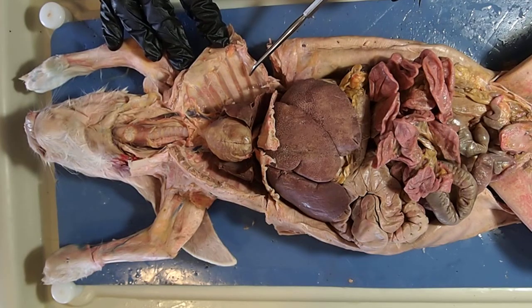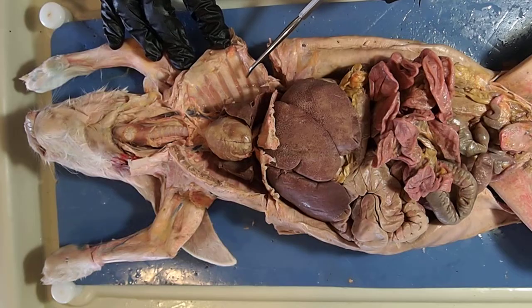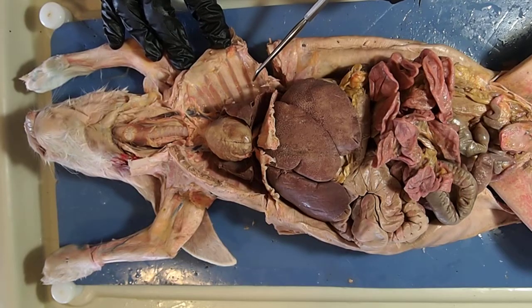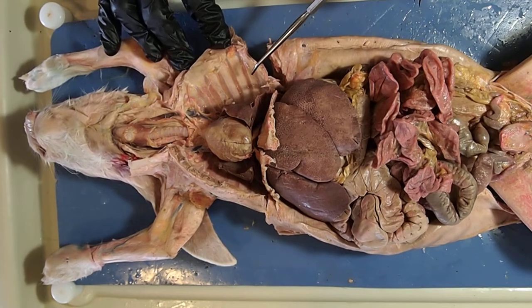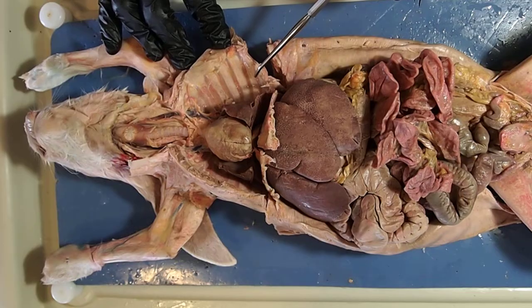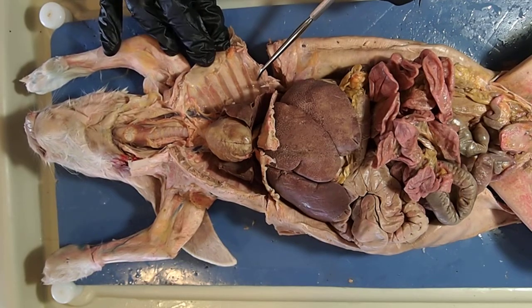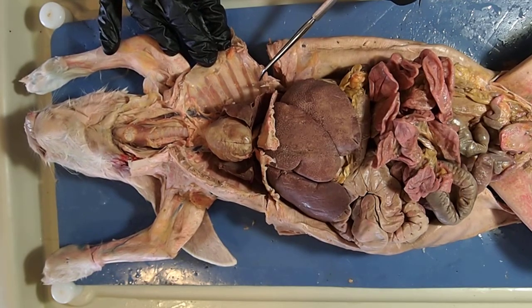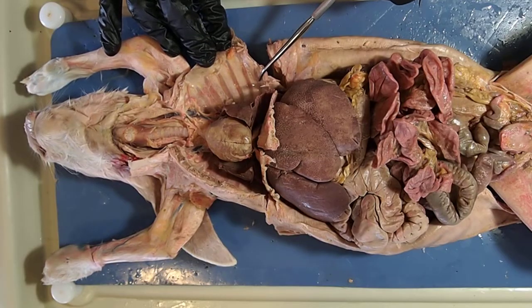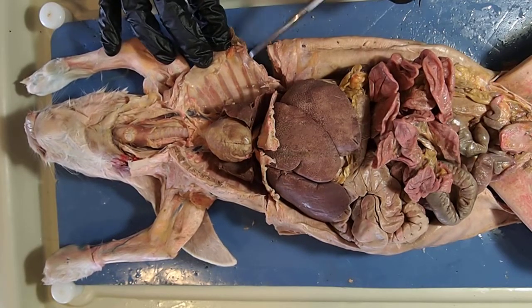You have the lab document with still photographs of all of these images and parts. You can refer to that lab document, and there's also a chart you can fill in for the various functions of the organs. For some of them I will be telling you the functions as we go through them.